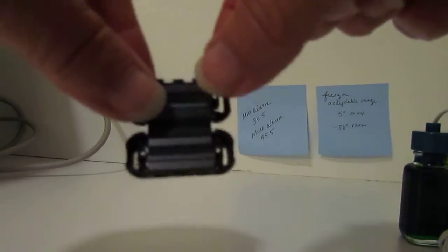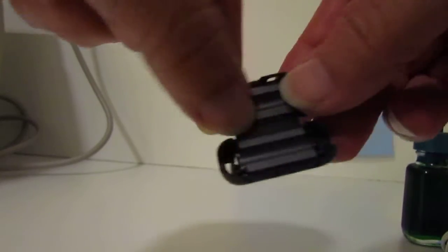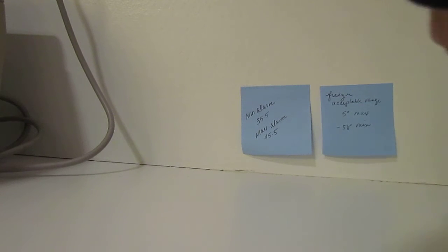Okay, here's another little tricky part. You'll notice these little things came in your package too. These are called static suppressors and what they do is they protect your thermometer against radio frequency.